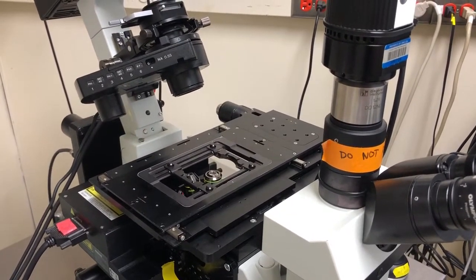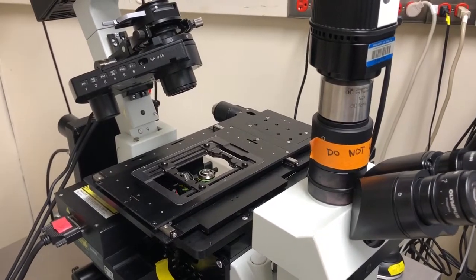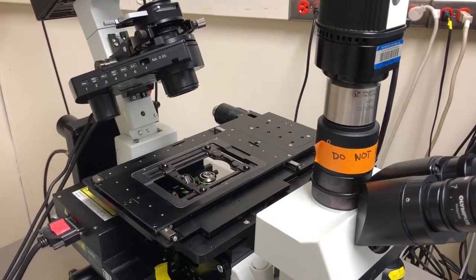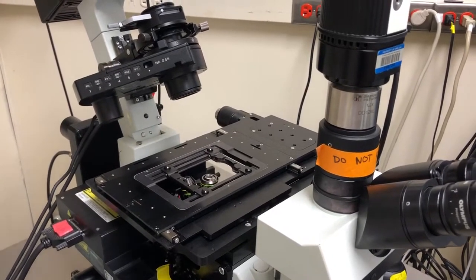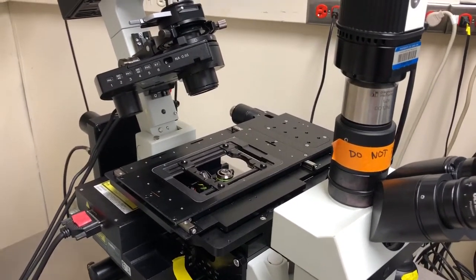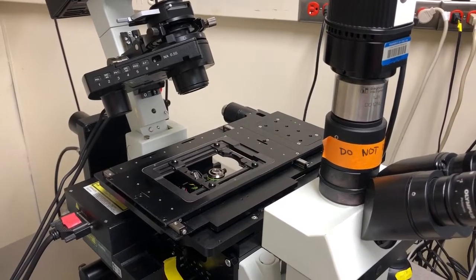This is the objective you should use if you're doing wide field deconvolution to look at subcellular structures with this microscope. The objective is very expensive, so you need to be very careful when putting it on the microscope.